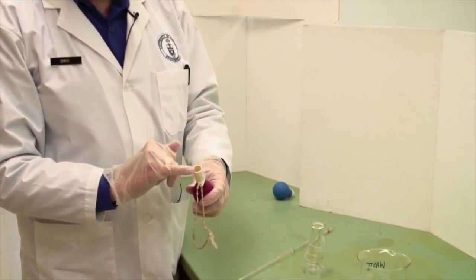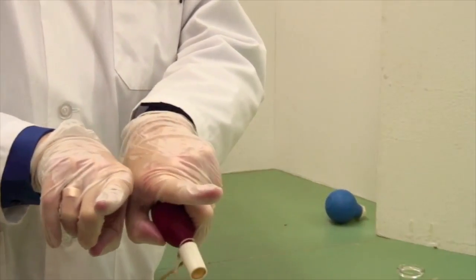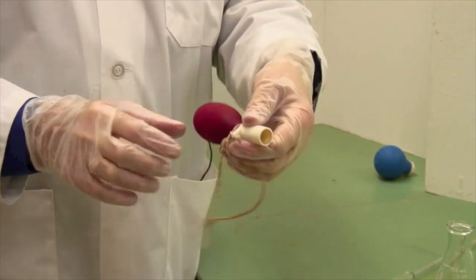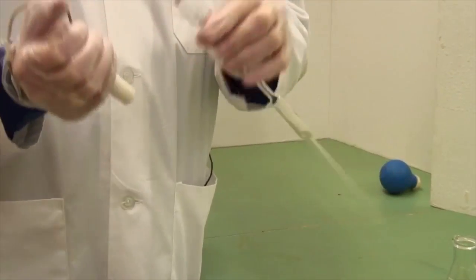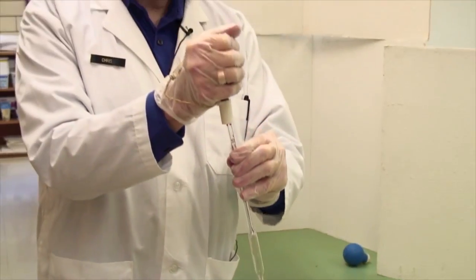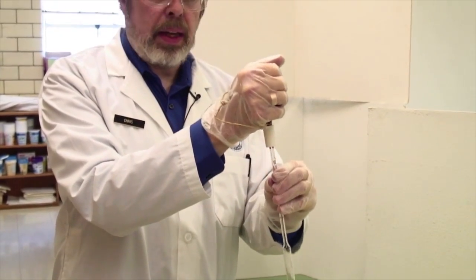Inside the neck of the pipette bulb is a cone of squashy rubber. That's what actually forms the seal. When you want the seal, you push up with your pipette-holding hand and you get a decent seal.